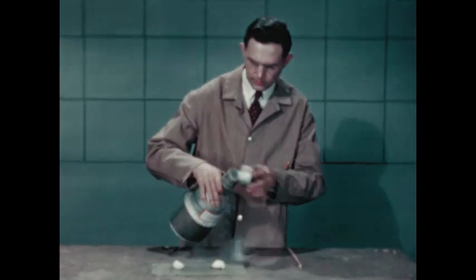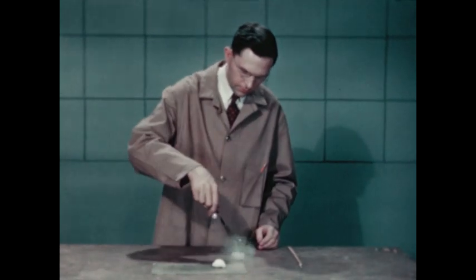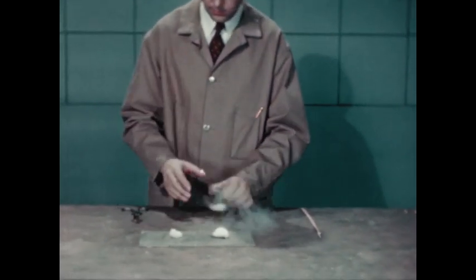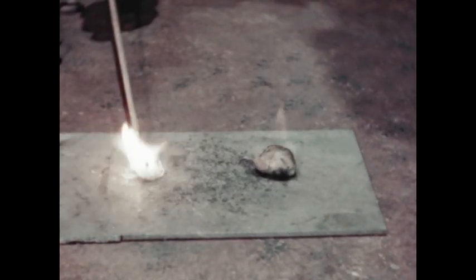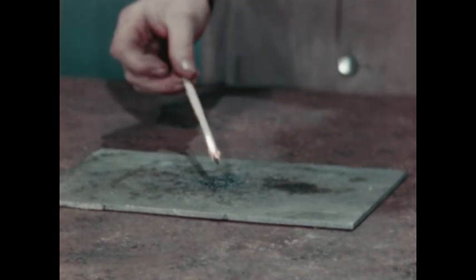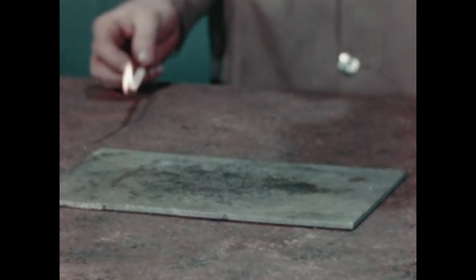Here is another demonstration of substances burning in the presence of excess oxygen. Soaking a cotton ball in liquid air gives a heavy concentration of oxygen — much more than in the surrounding air. As the liquid air evaporates, watch this gunpowder. Rapid oxidation reactions which evolve light as well as heat are called combustion reactions.